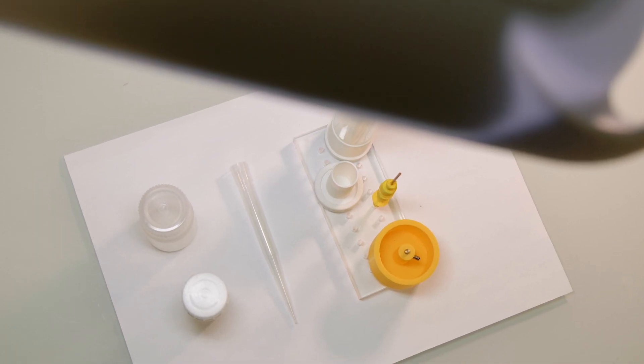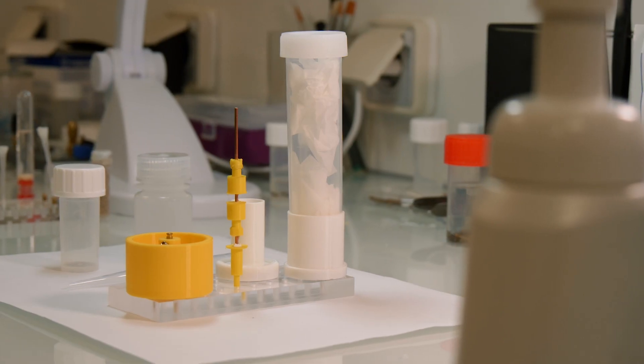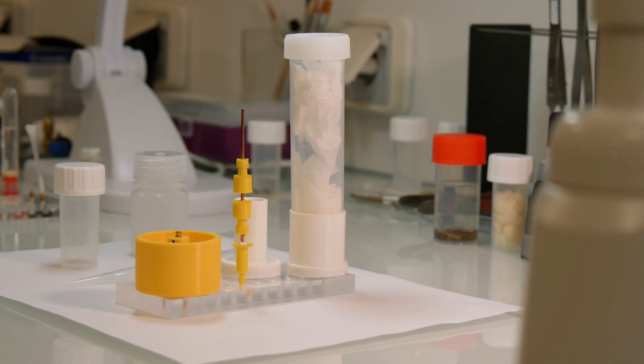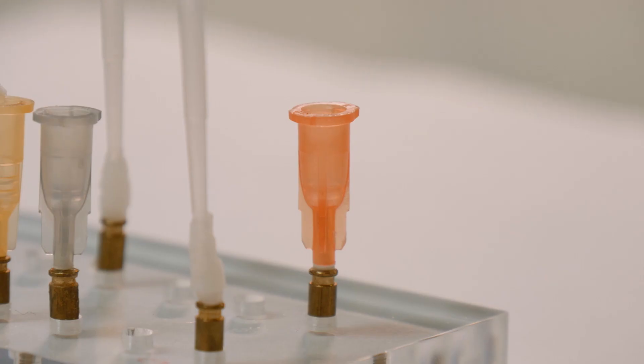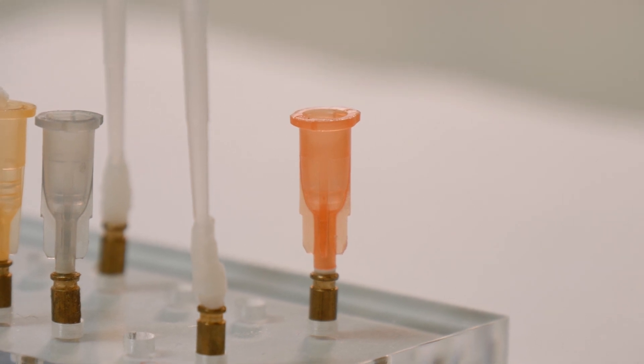Other samples and containers can be mounted similarly. To discuss your needs and plans in more detail, just get in touch with us.